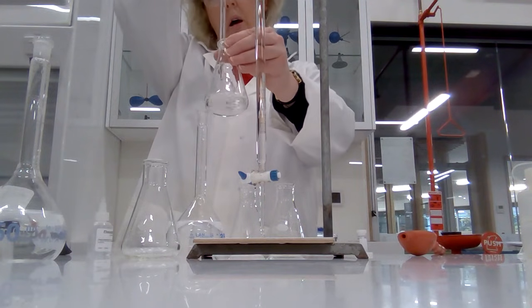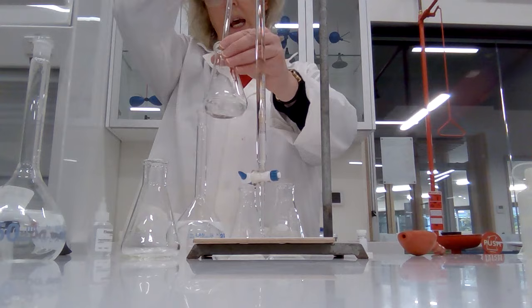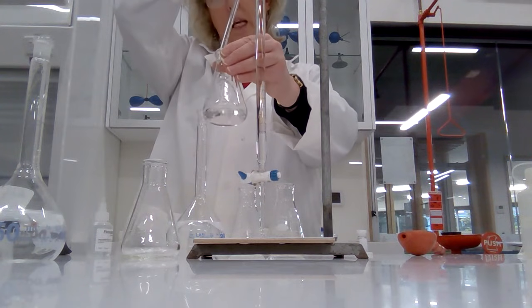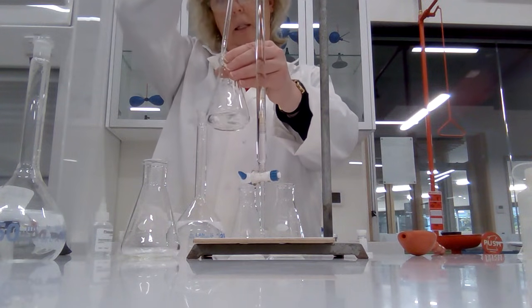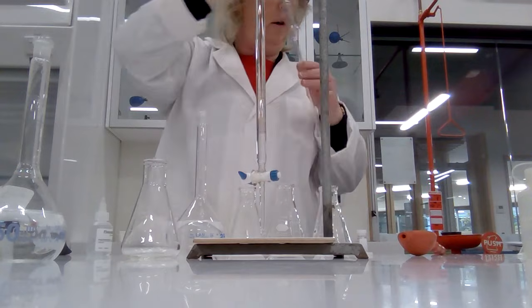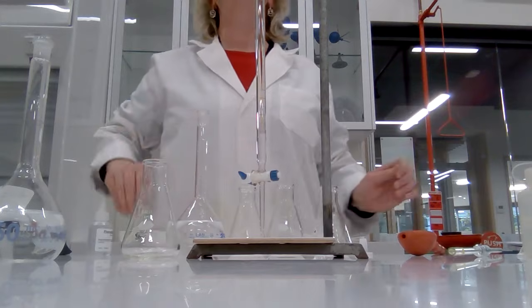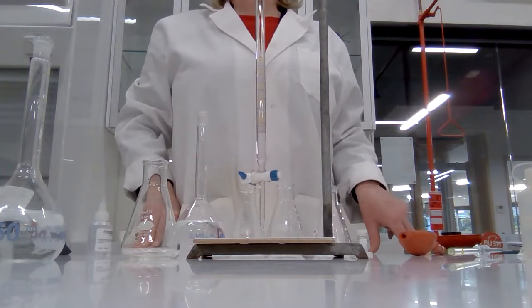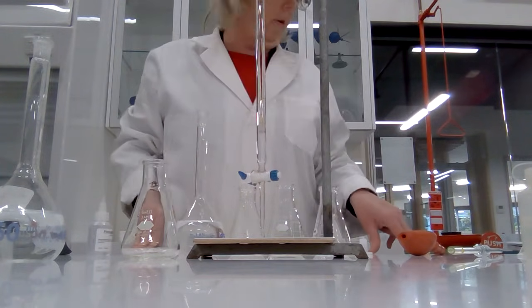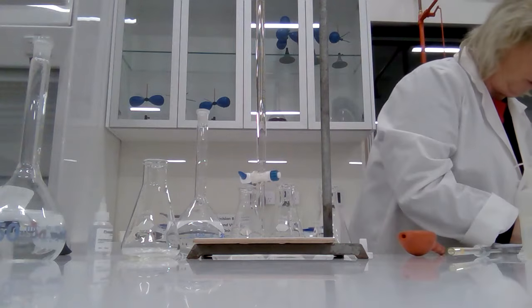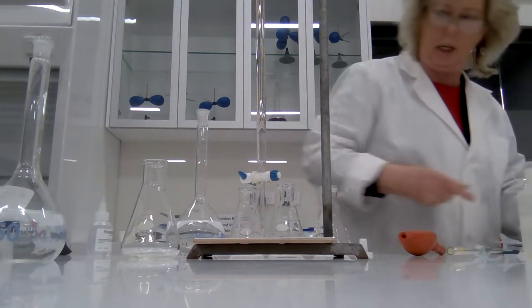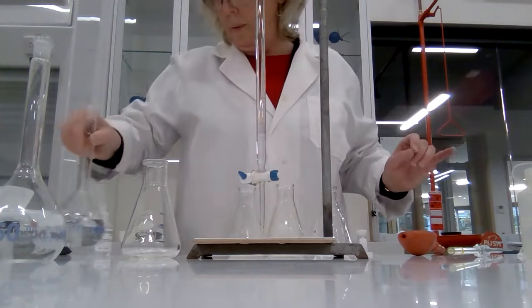Now I'm going to read the burette again because this burette's got a little bit of a slow leak. It is 0.40, so write that down, 0.40 initial volume.